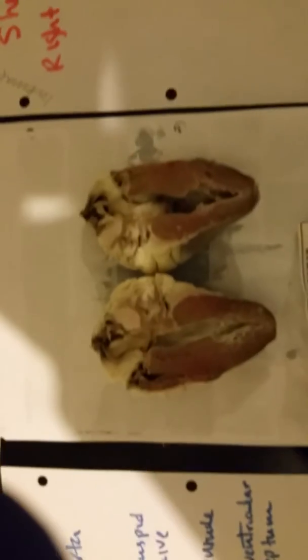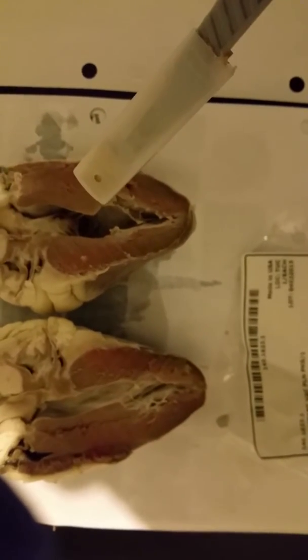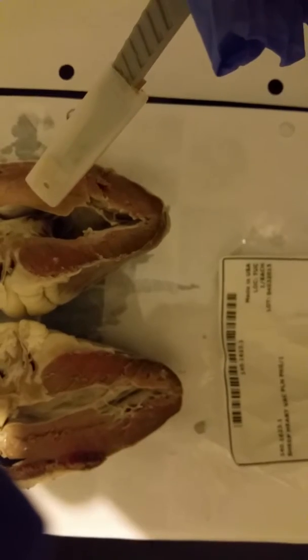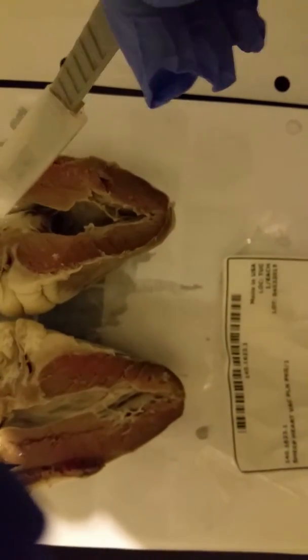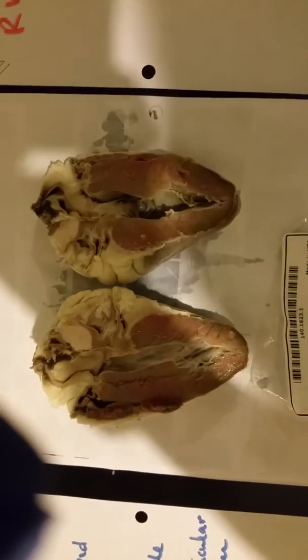So with the mitral valve, as we move on to our description here, we know that that's the left AV, while when we're looking at the tricuspid, that is the right AV. Now moving down, we've already discussed the ventricles. So now we're going to talk about the chordae tendineae. Right here. Okay? The chordae tendineae. I'm trying to not touch the heart more than I have to, to avoid cross-contamination. So I'm just pointing in the area.